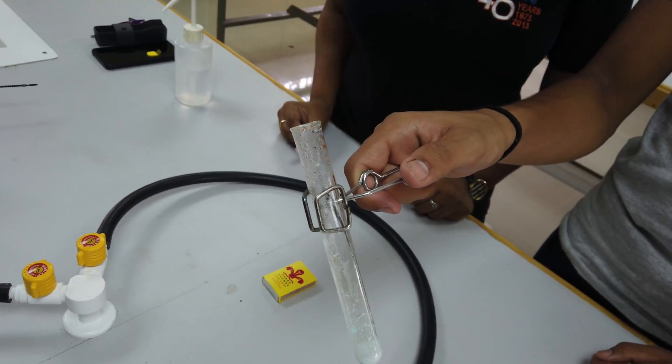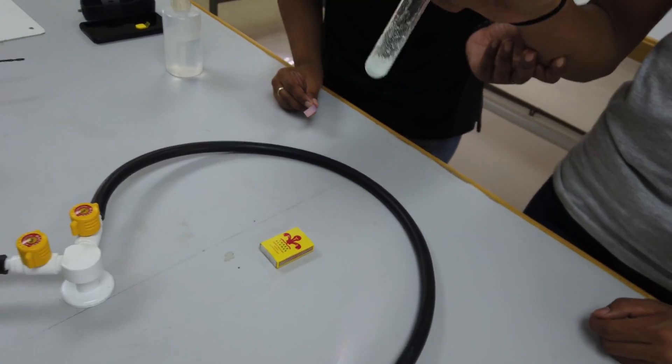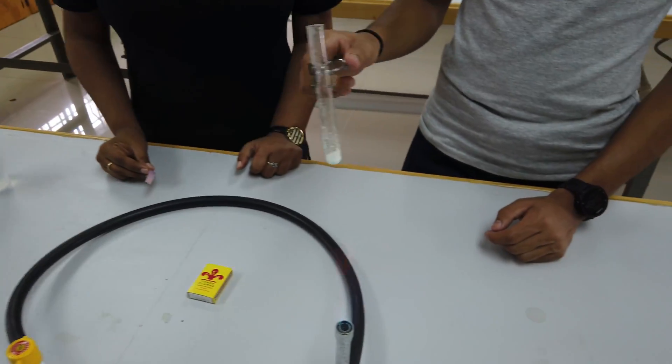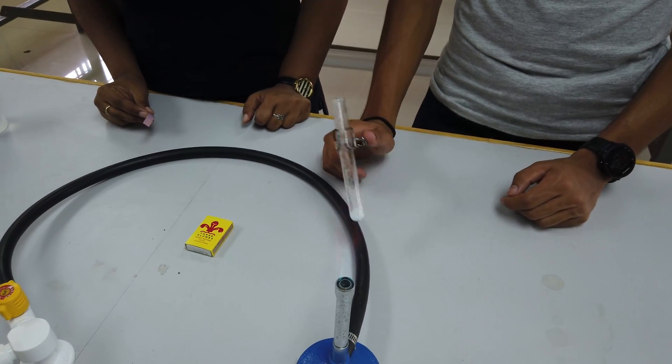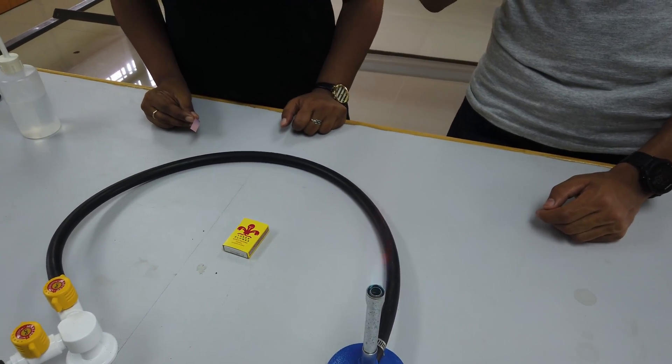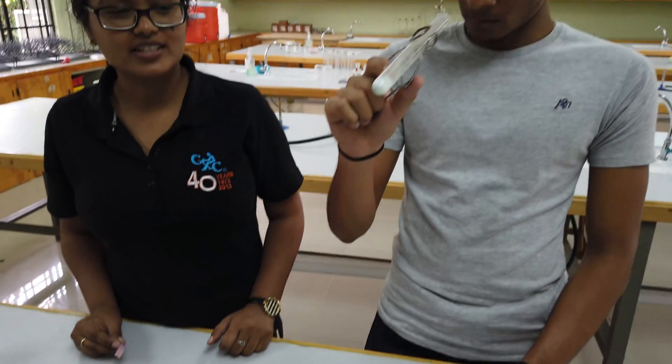Note the color of the inside of the test tube now. It's very cool. Inside of the test tube you've seen the steam where the gas was released. What color was the gas?